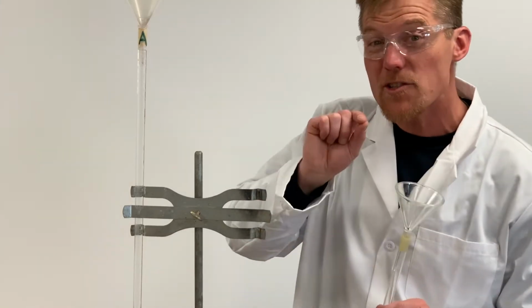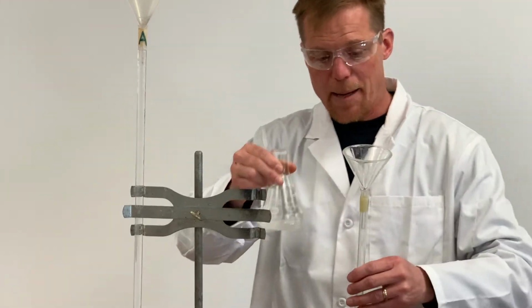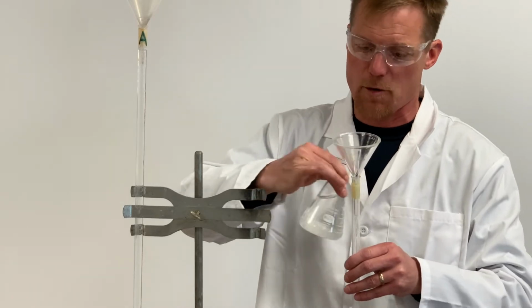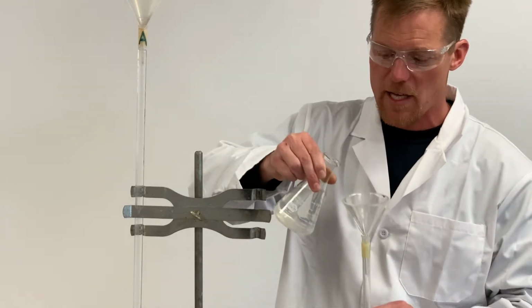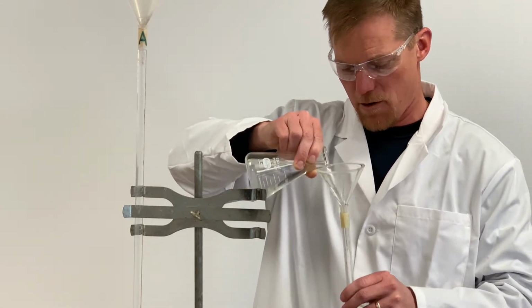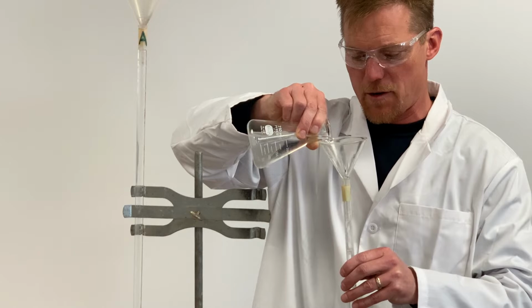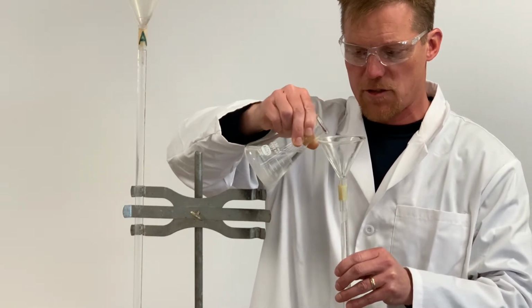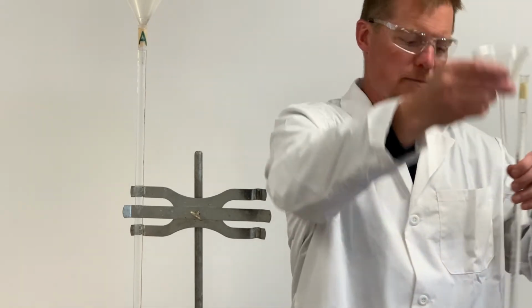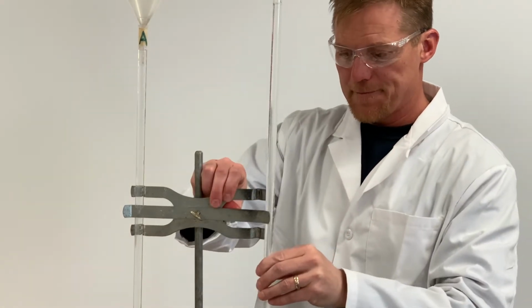I've got my funnel, which I also rinsed with some of my base. I already did the same thing for my acid, burette, and funnel. And I'm gonna pour this slowly. These things fill up quick. It's really easy to think that you're not going fast and all of a sudden, boom, you're overflowing your burette. Stopcock's closed, got my burette below eye level, and I'm gonna add my base. I'm gonna keep track here of how quickly it's coming up. Now I don't need to hit it right on the 0. If I do, great. If I'm below it, that's fine too. Doesn't matter, okay? I'm a little bit above the 0. I'm gonna pull out my funnel and we'll talk about how to adjust this in just a little bit, okay?